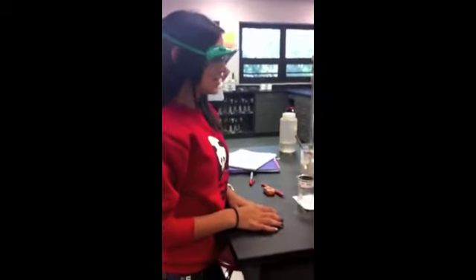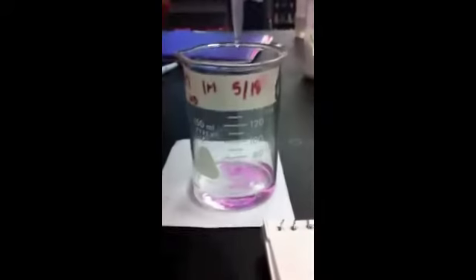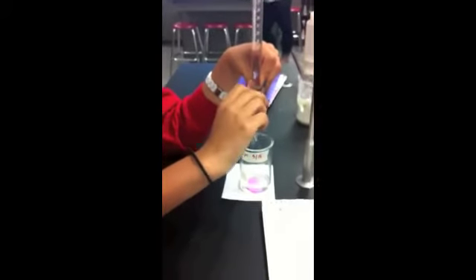You can titrate at different speeds depending on how fast you spin the stopcock. Pink phenolphthalein starts to show. It is important that you stir so that all the phenolphthalein is mixed in. When you can't stir the phenolphthalein anymore, that's when you know that you're done titrating, and that's when your solution has reached its end point.